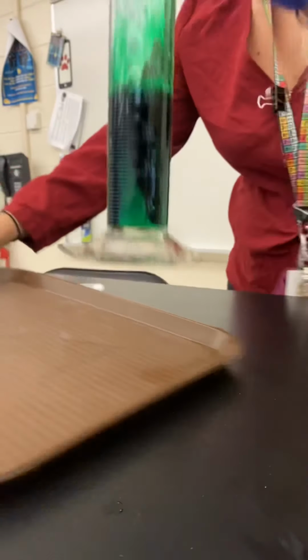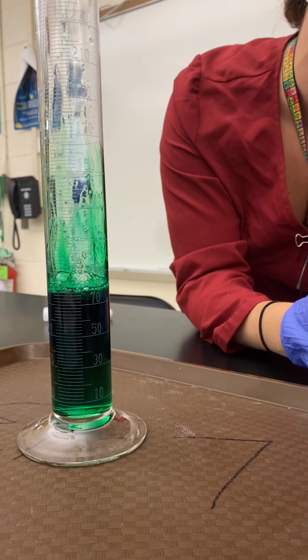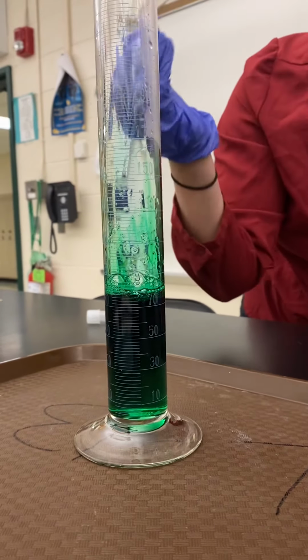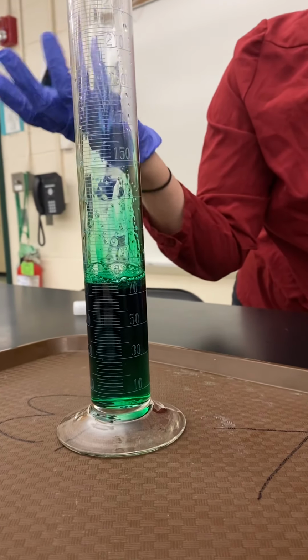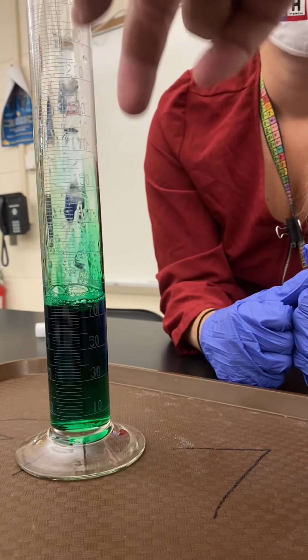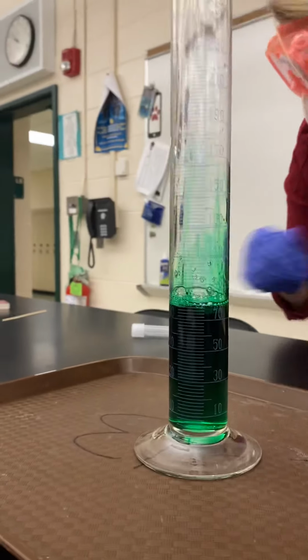All right. This is sometimes called elephant's toothpaste. I don't know if you've ever seen this demo before, but it's called elephant's toothpaste. The reason is because when it shoots out, it kind of looks like toothpaste coming out of a tube. And they used to do the food color on the side of the glass, a red and a blue streak, so that when it comes out, it looks like toothpaste. That's even cooler. I'm not that artistic though.